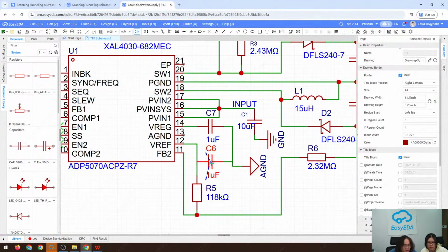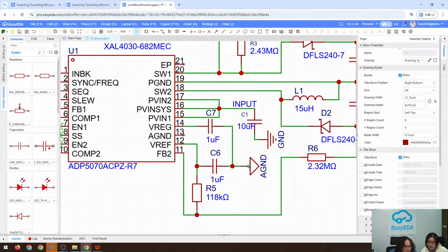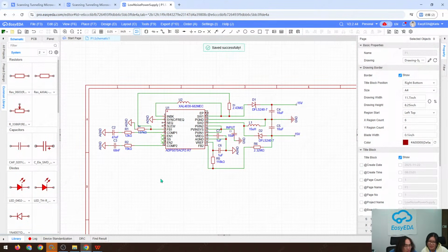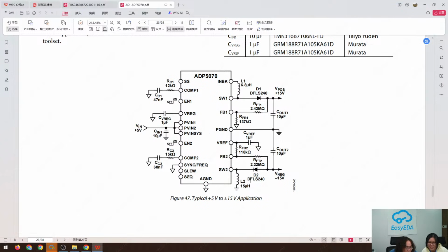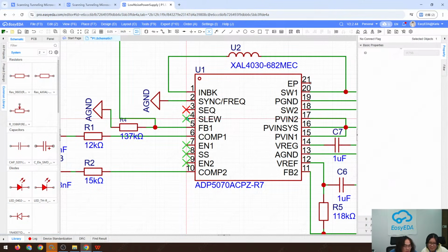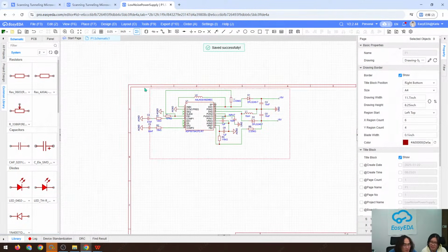Okay, and the AGND, where's AGND? Oh, it's select the symbol, just connect it to here. Oh wow, now we have finished our SEQ, SLEW, we can float. So it can be floating. So now we have finished our booster design.